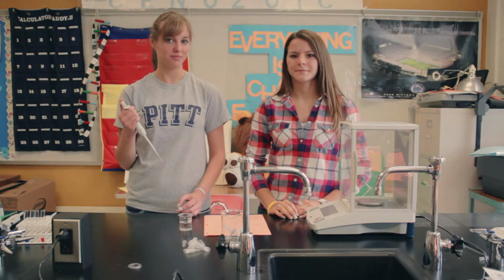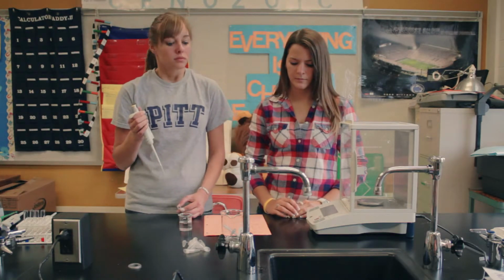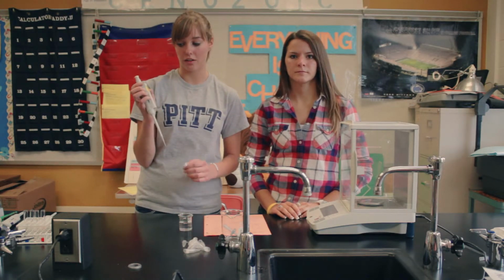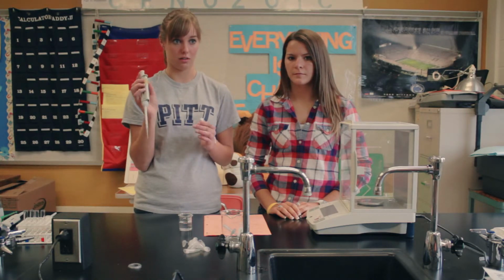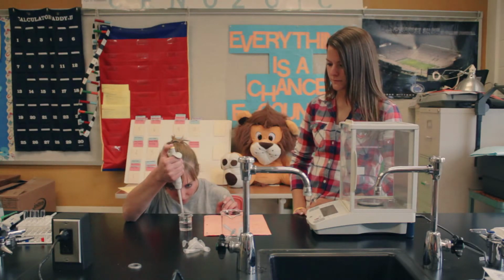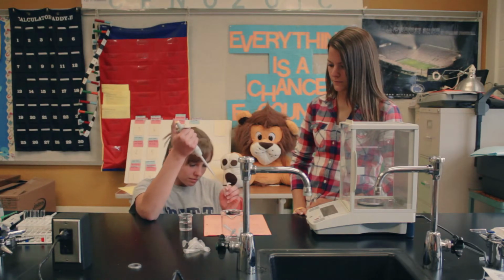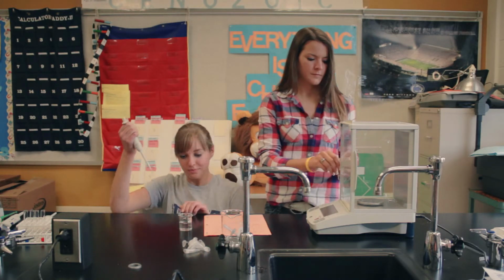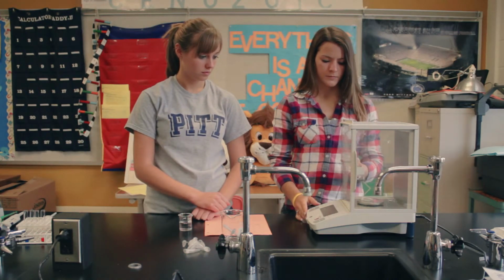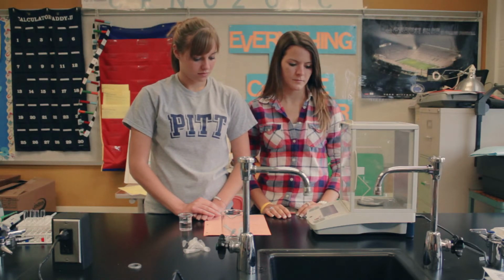So now you're going to use the appropriate micropipette, and Ms. Anselmina will give you different measurements that you have to take. Transfer the first amount of water into the centrifuge tube. Just a reminder, when you use the Eppendorf, the line on the reading acts as a decimal point. And be careful to watch out for bubbles while you're taking this reading. So now once you've filled the microcentrifuge tube, put the sample into the analytical balance, and you're going to get a measurement for the mass of how much water is in the tube.